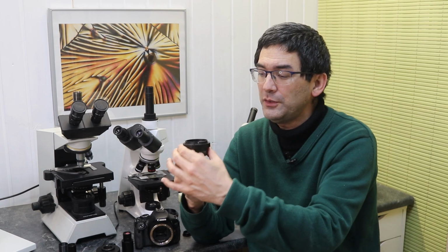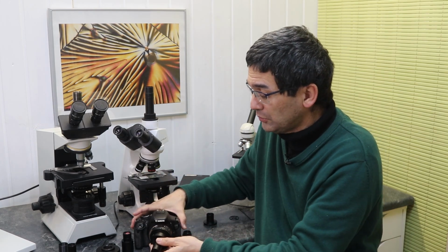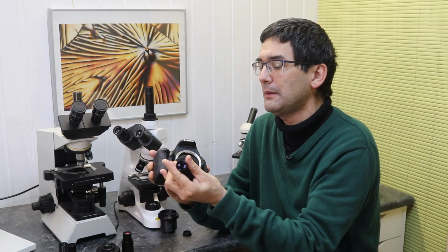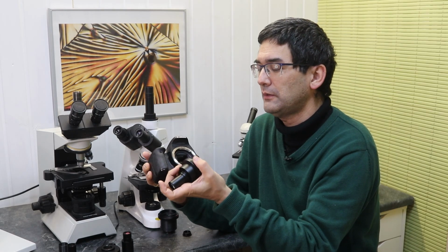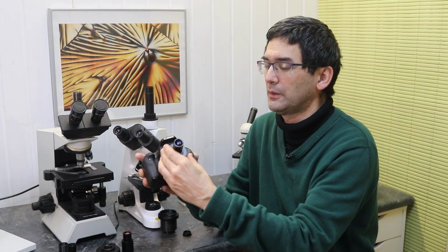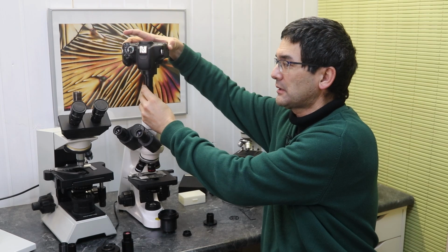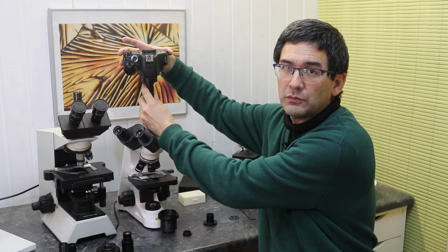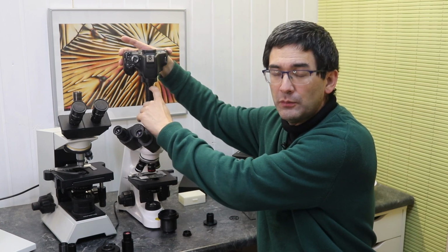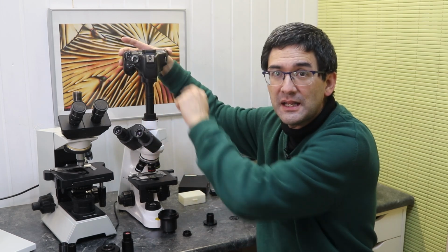And when you have such a DSLR adapter with optics, then you're able to connect this, of course. I have to find the place now, and then I'm able to see. I cannot even find it in alignment now. Okay, let me see, where is this? Yes, here we go. And when you have it connected like this, I'm able to plug it in just like a regular microscope camera, and the optics will now pick up the image where it is supposed to be, and then it will resize the image, and then I have an image that's in focus both in the eyepieces and in the camera.